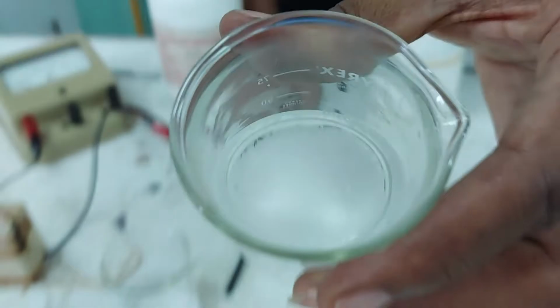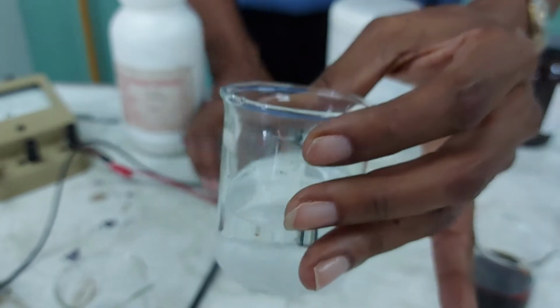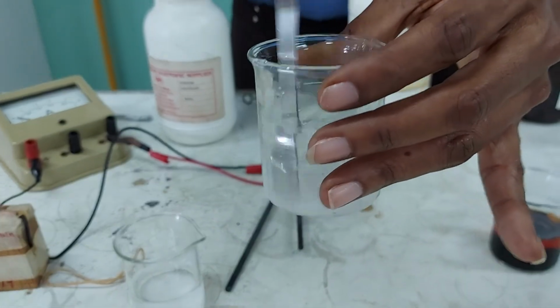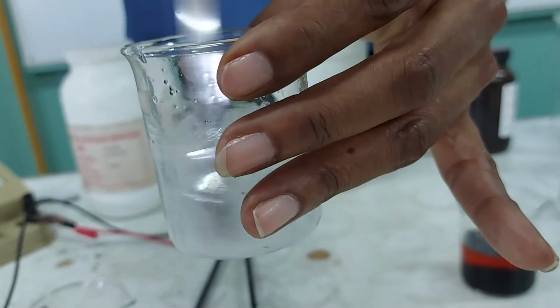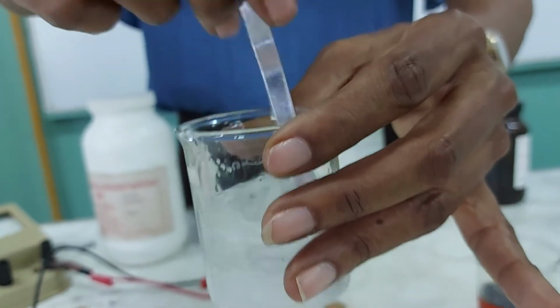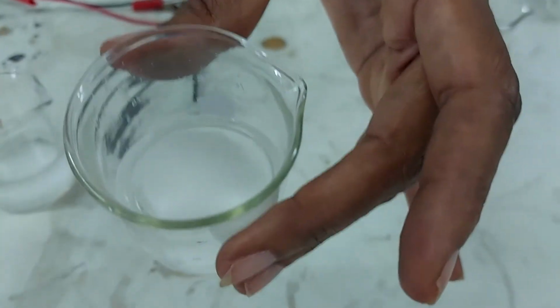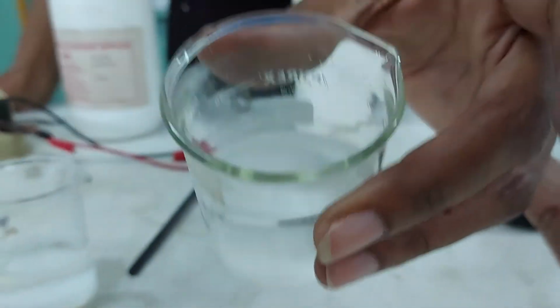And the last one, oh, I didn't show you though. Look at what happens when you dissolve the sucrose in the alcohol too. All right. I think I'm going to try to give it a further stir and see what happens, because sometimes it's not readily soluble apparently. If you can, what you can do to compare, you can pause and you can screenshot and you can take your pictures and compare before and after, right, and see what happens. Okay, so it's not really readily soluble, I would say, but there probably is a small amount of solubility. You tell me, you be the judge.